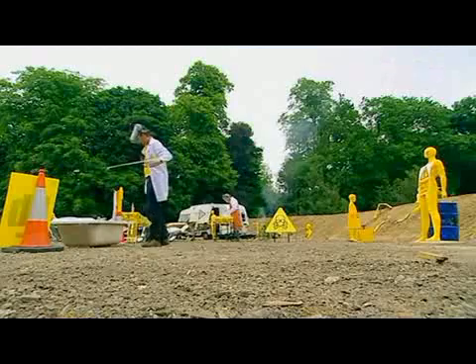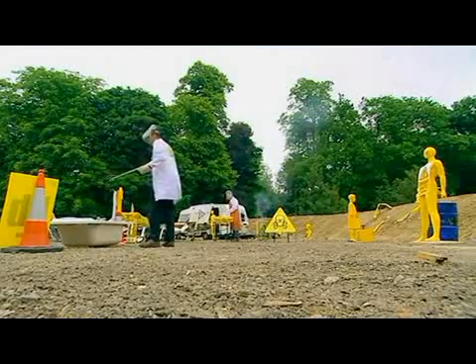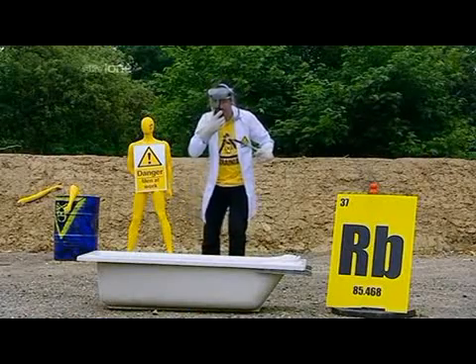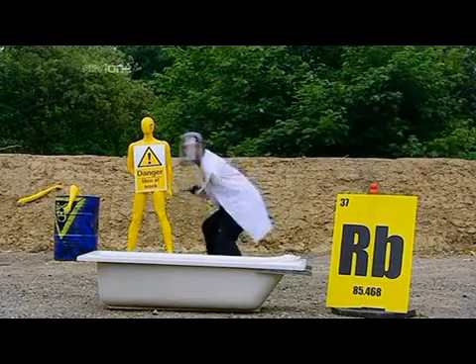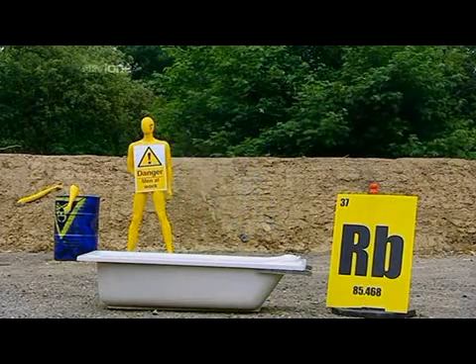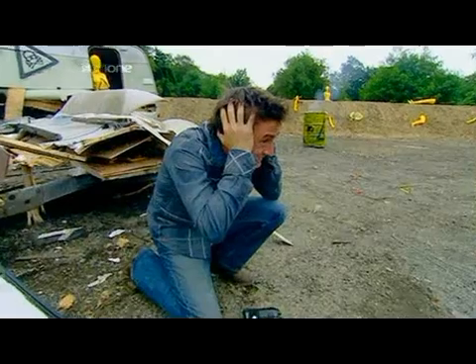Okay, Tickle, drop the rubidium in the water. Stand back, everybody, this one's going to be bad. 2 grams of rubidium will only react when our specially designed vial dissolves in the water, which gives John a few crucial seconds to get into our safety zone.